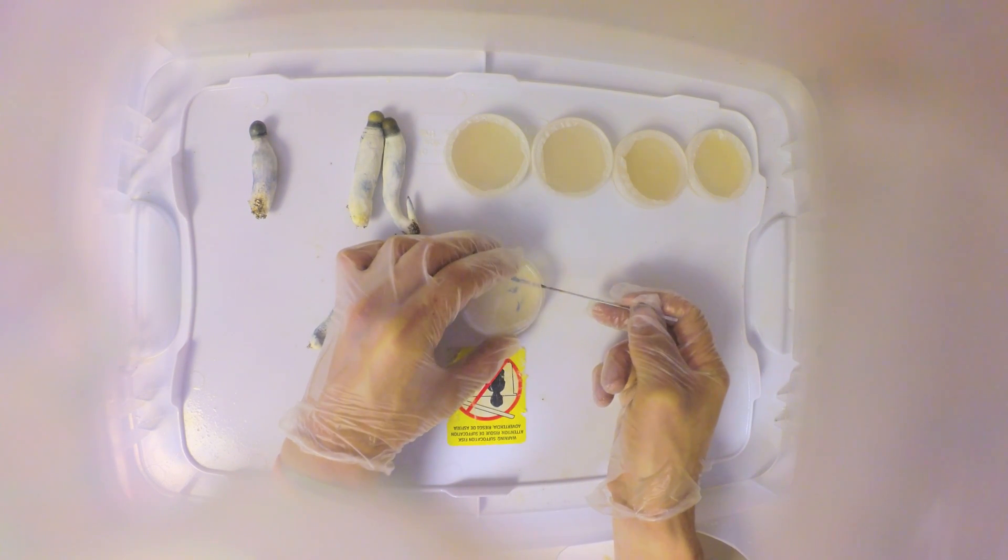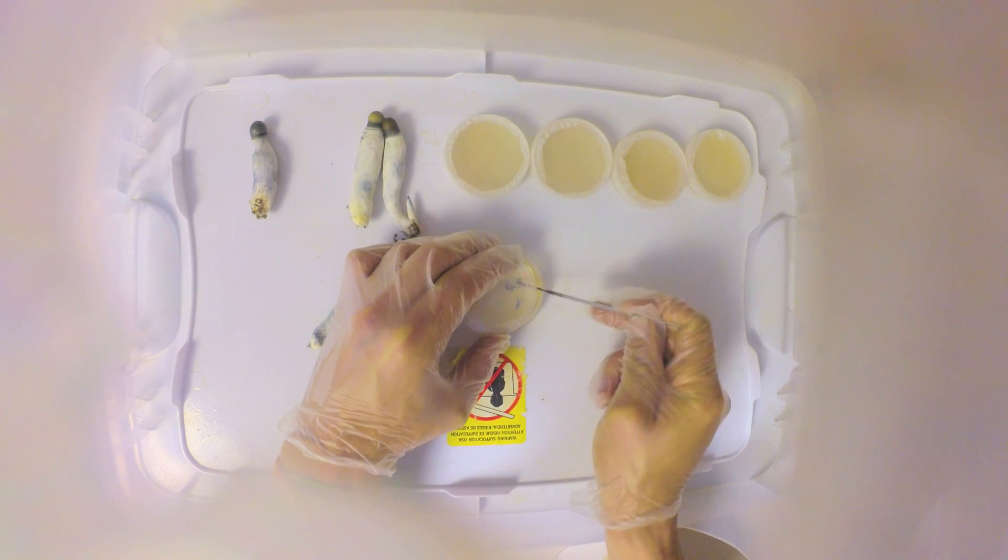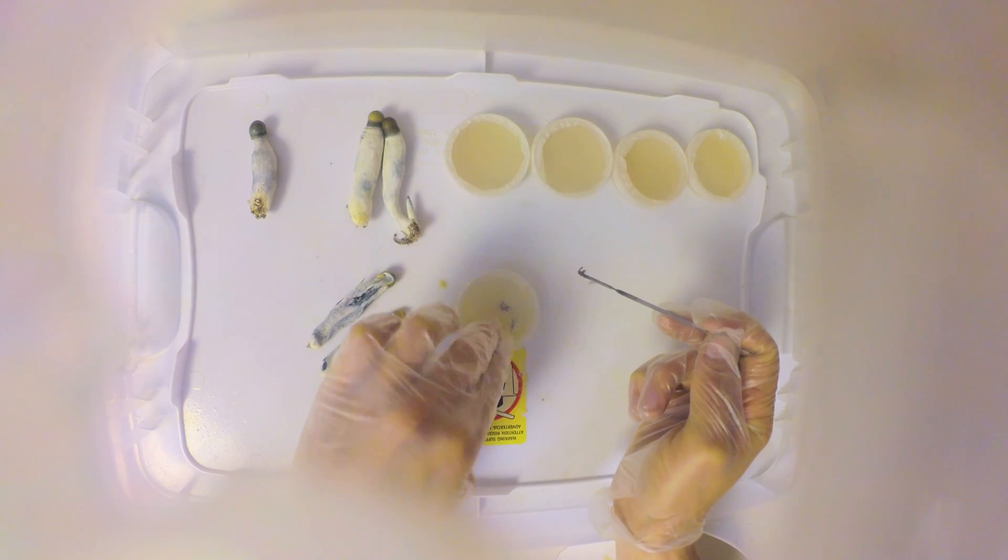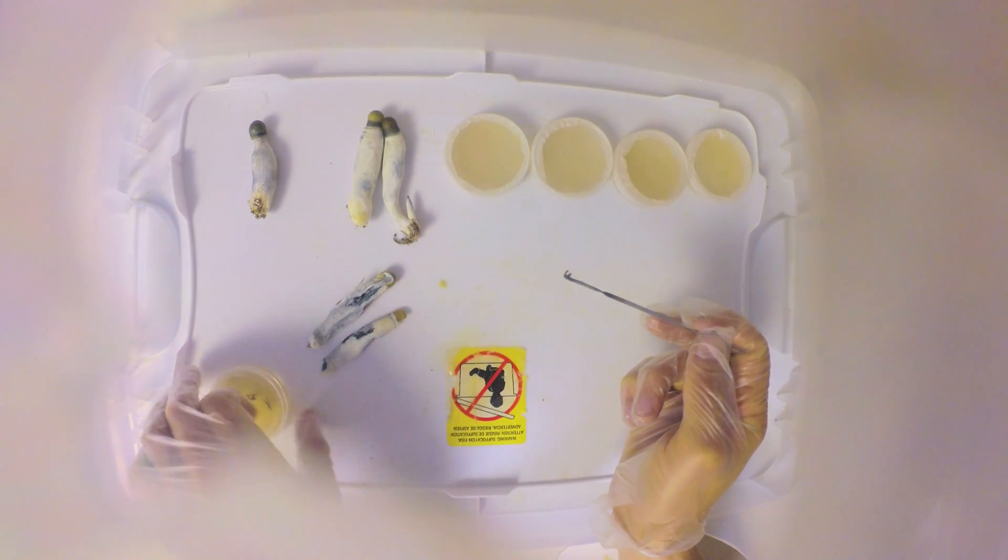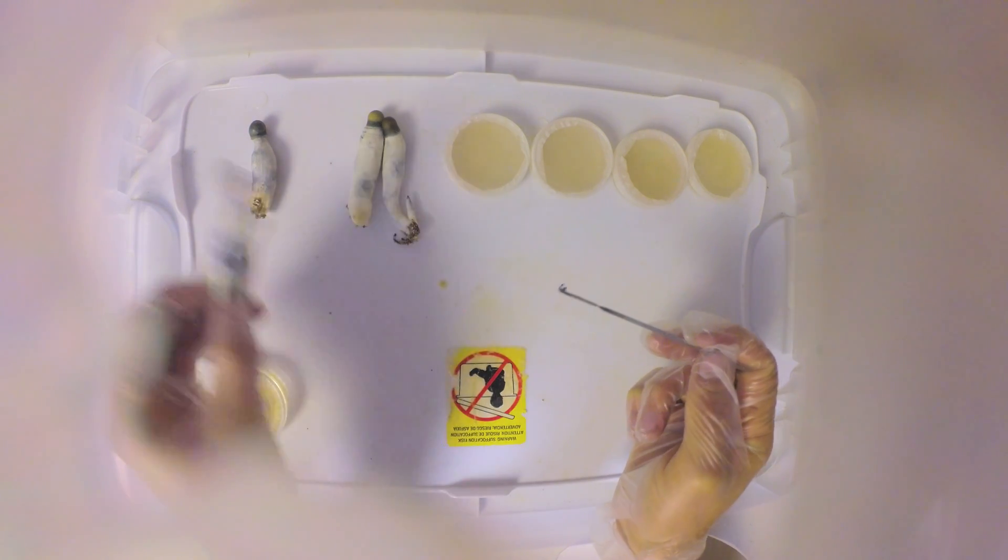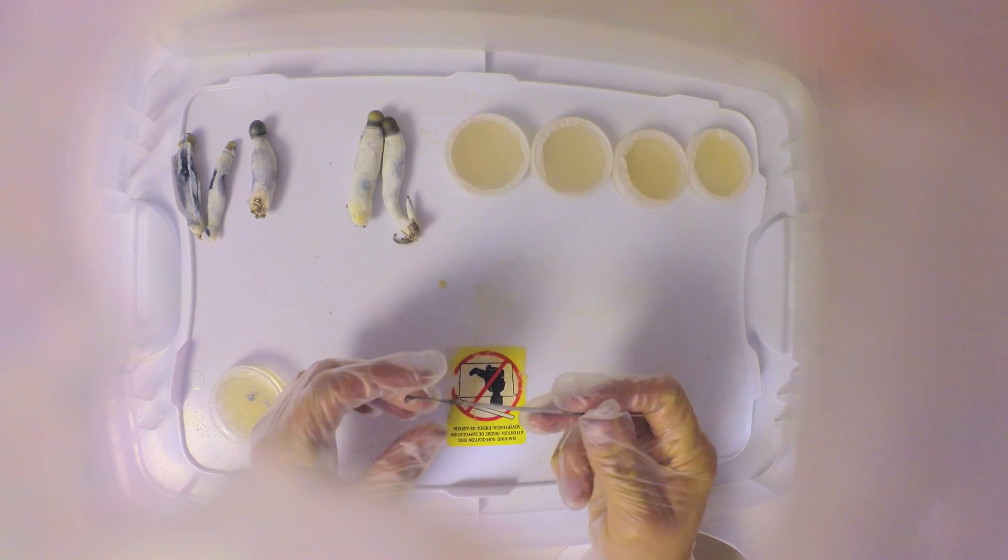If it's not coming off, I might get contaminations on this. Place it off to the side and you're done with that mushroom. I'm going to go ahead and do this for the rest of the mushrooms. I'm going to flame sterilize in between each one.